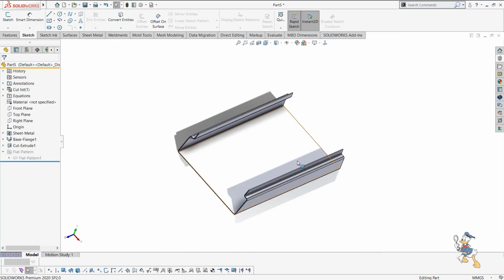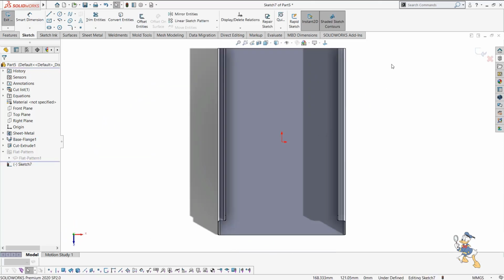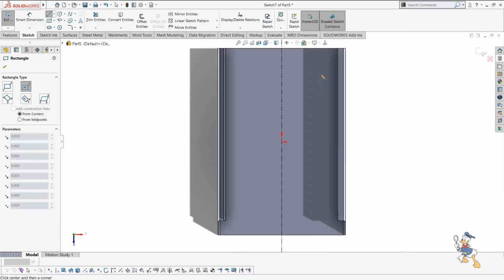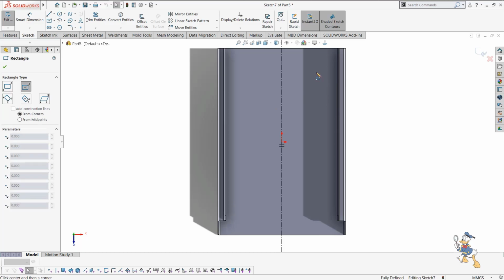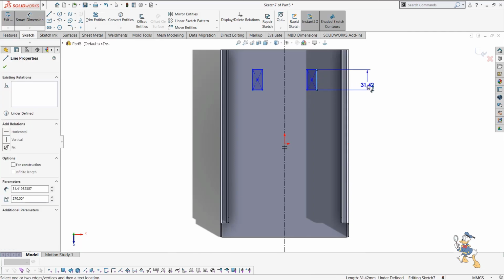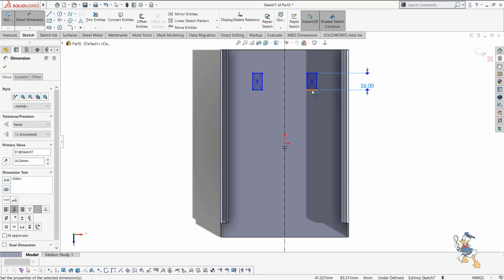So now we just need to design some more stuff in it. Suppose we need to design some cuts. We can design cuts as well. So we need to start with a line again, to design a rectangle. The rectangle is just like this. And now we just need to define the dimensions of this. Suppose it will be 26. This will be like 11.